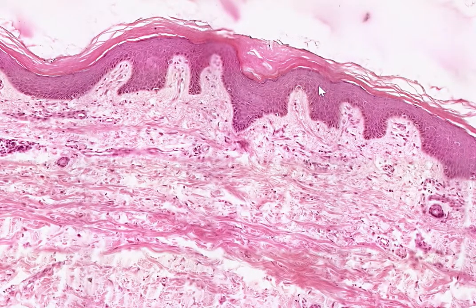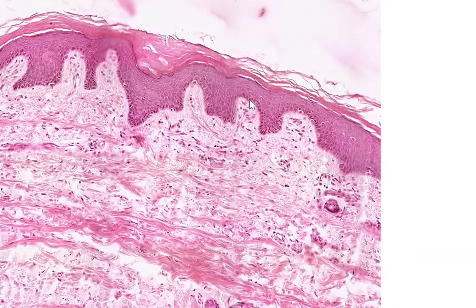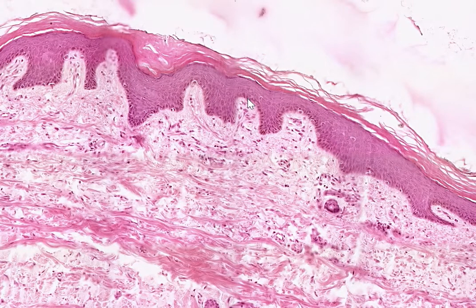The epidermis in skin is keratinized stratified squamous epithelium. That we have squamous epithelial cells that make up the top layer, and stratification, that means we have different layers. We have a couple of layers of epithelium, so we call it stratified, and we call it stratified squamous because we always name the type of epithelium according to the most upper cell. And then in this case it's keratinized because we have this thick keratin layer here.